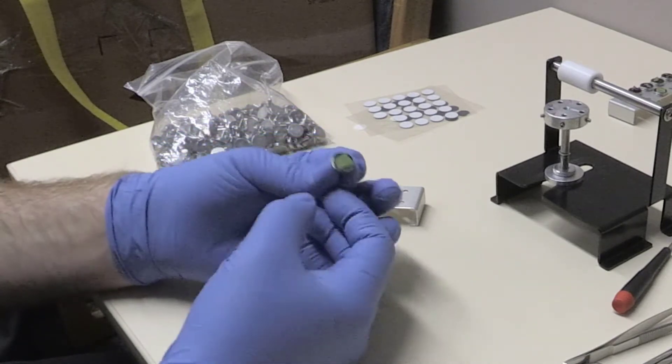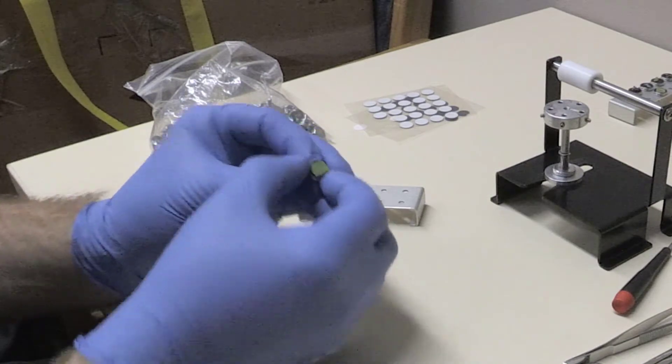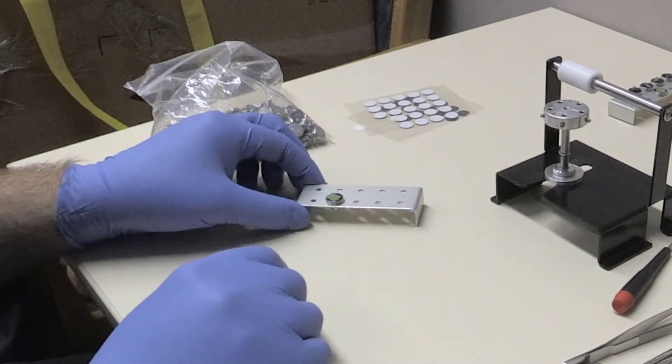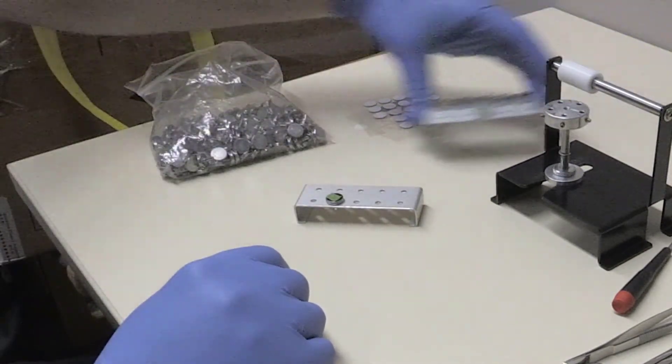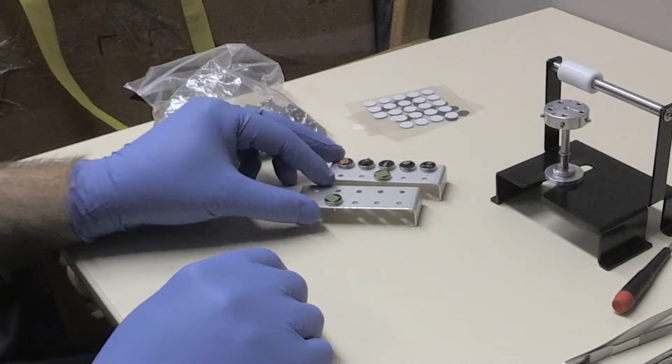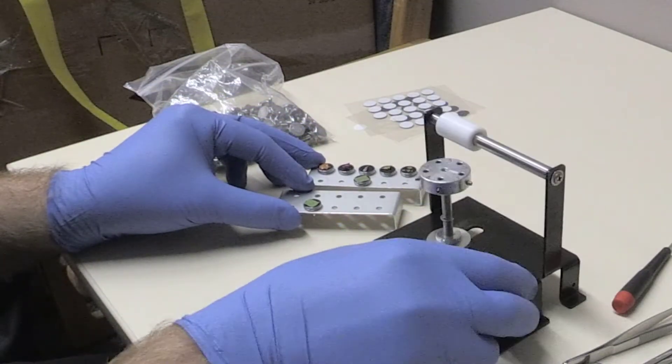Then, secure the specimen to a mounting pin. If you have more than one specimen or if the SEM is currently in use with other specimens, place your completed specimen mount in the mounting pin holder.